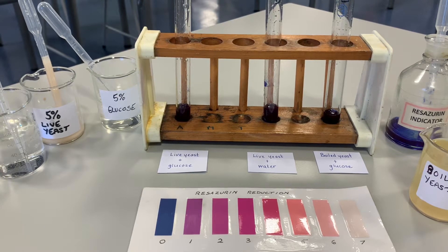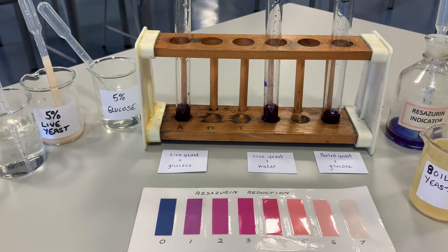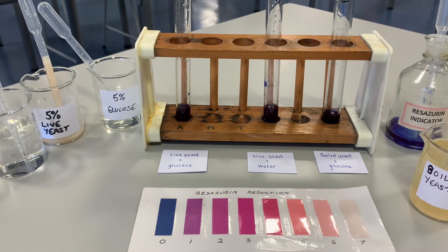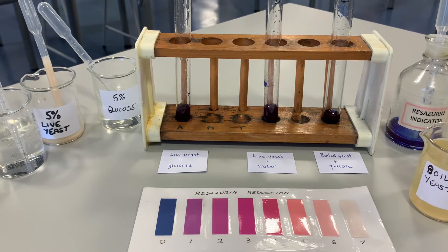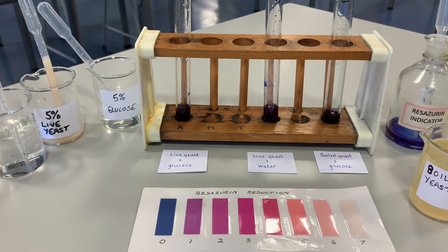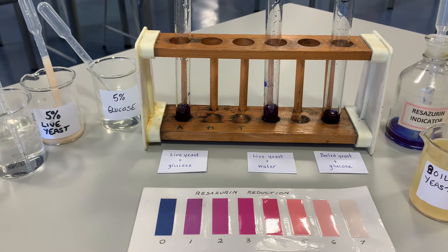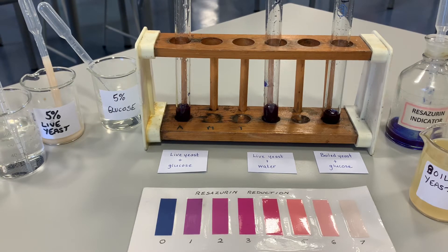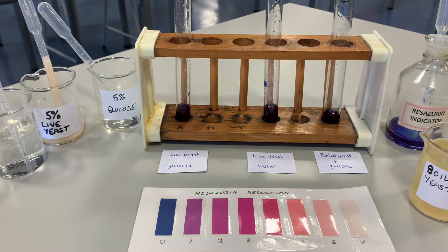In this experiment we're going to look at the activity of the enzyme dehydrogenase. In respiration, the purpose is to break down glucose, and when you break down glucose to release the energy you also get the presence of hydrogen, because what dehydrogenase does is it removes the hydrogen ions and high energy electrons. We're going to have a look at that enzyme.